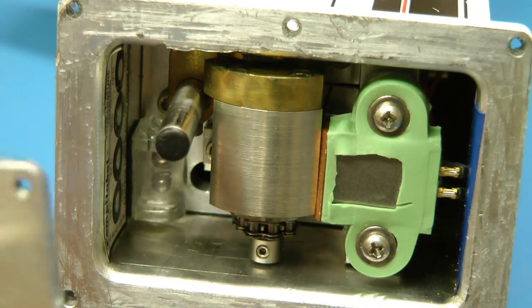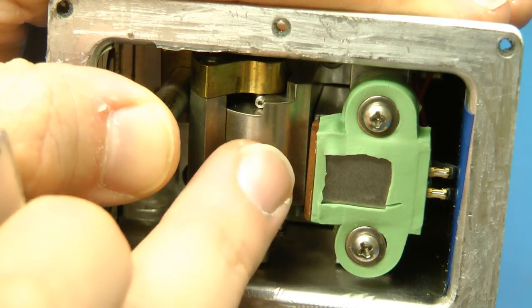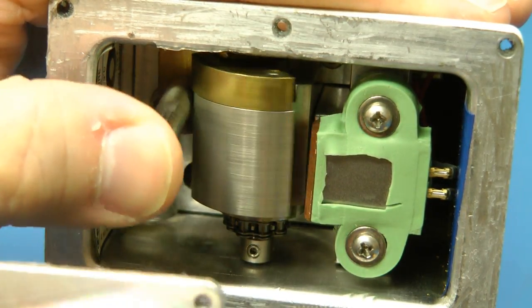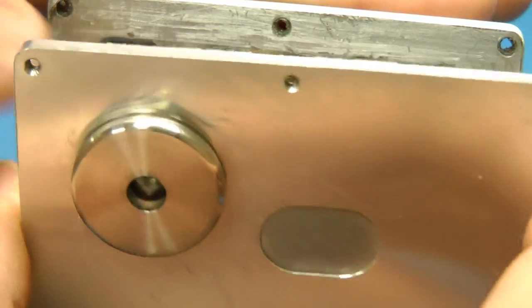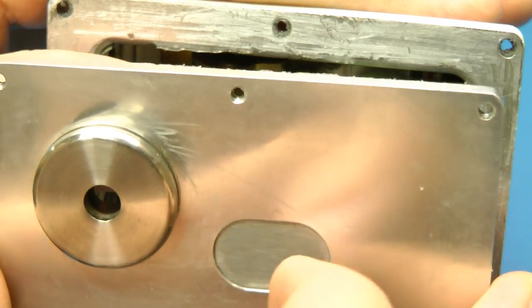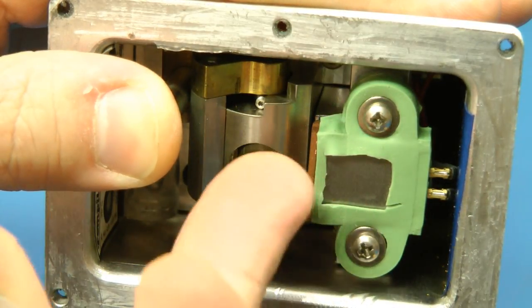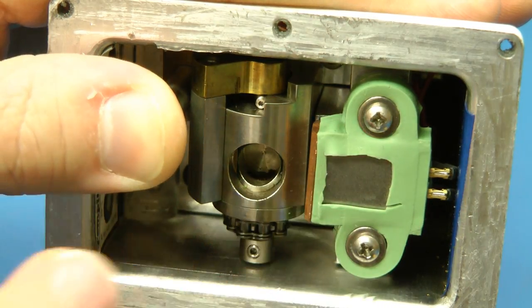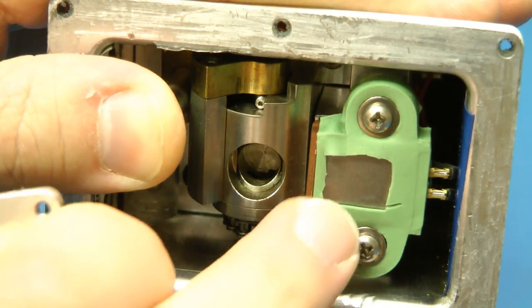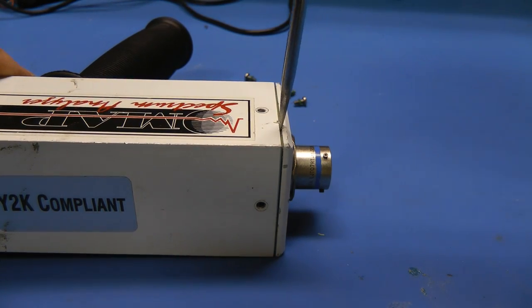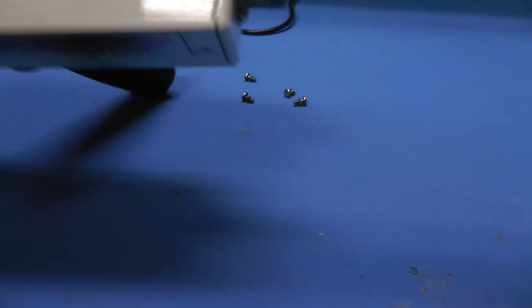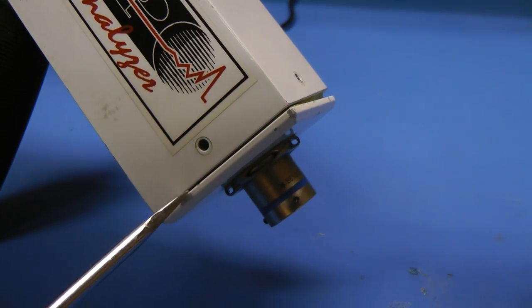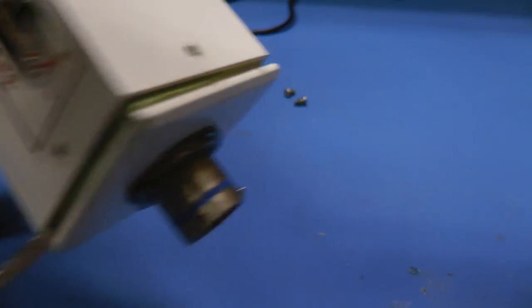There's a very thin, probably aluminum plate for the X-rays to go in and out of. And then around the outside, there you have more silicone that has been removed. And this must be the X-ray sensor here. There's some copper shielding in between it and the source. Let's look at that. So the source looks like it, based on the positioning of this piece of metal here, would expose sort of at an angle. Then it would capture the results at an angle from this, that must be the detector.